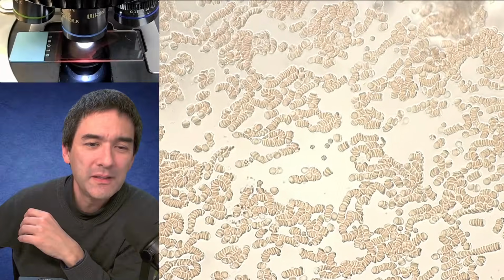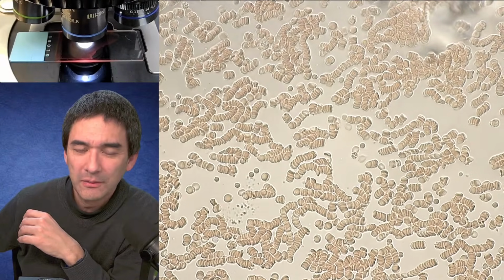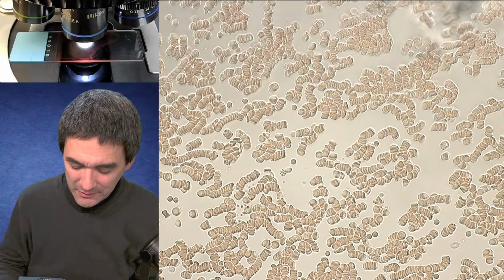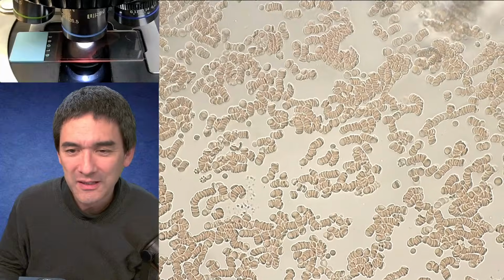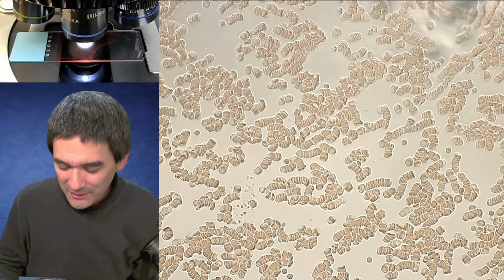Yeah, and that's basically with a real microscope. So I think it's very clear that this microscope over here has its limits, obviously. So what I'm going to do now is the following.